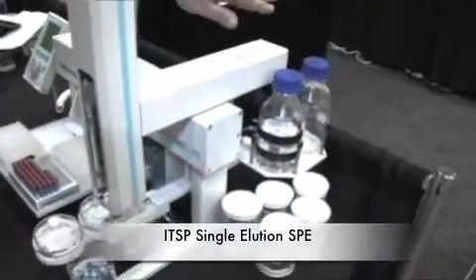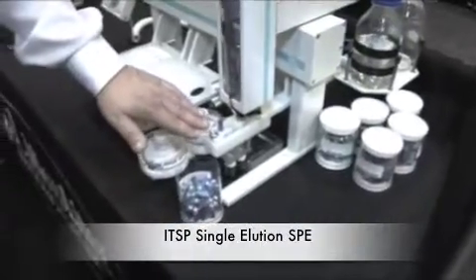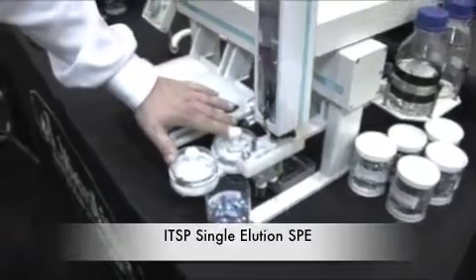What we're showing is ITSP, instrument top sample prep, and what we're using is a standard autosampler for an LC or GC to do solid phase extraction or general filtration. What we're going to show you today is a single elution SPE method where we use an HTC PAL from CTC Analytics, and we will condition the device with these solvents back here. We will have a waste location here where we'll move our device, and then we'll have elution solvents here.